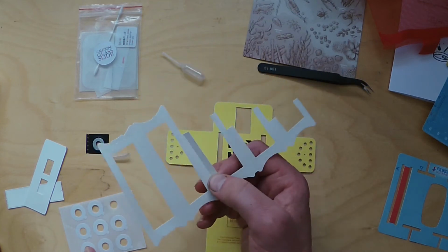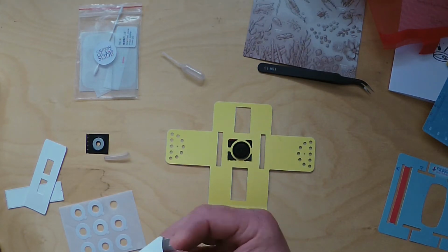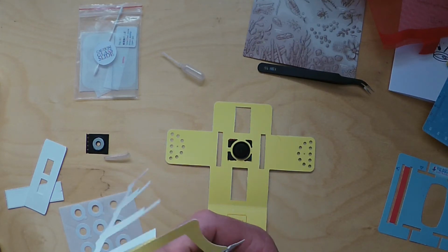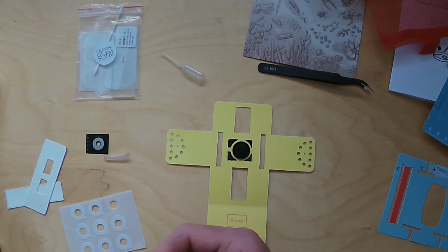This is quite a strange, slightly confusing thing, but basically find all those perforated lines and you want to fold into them. It's quite an unusual item, but you'll see once you've folded all these perforations, there we go. You can take a little bit more care than I am, because I don't want this video to go on for absolutely ever, but make all those perforations work. That's something I could have done earlier. And then you want to concertina them, and it'll make sense shortly why. Okay, that's that one. Then let's get the other perforation. There.